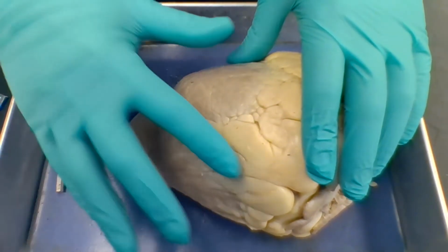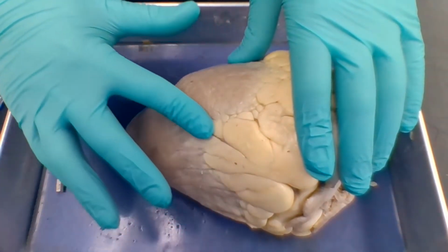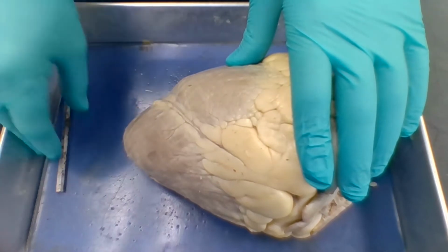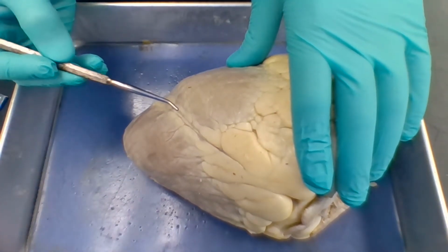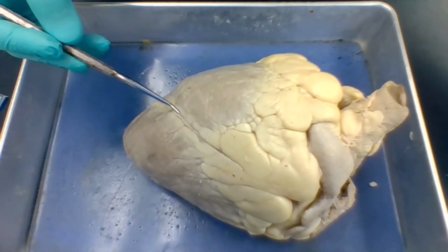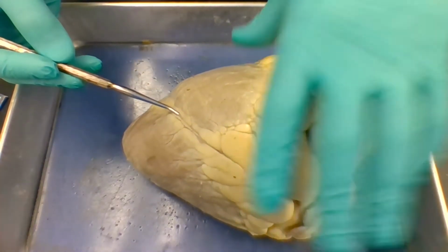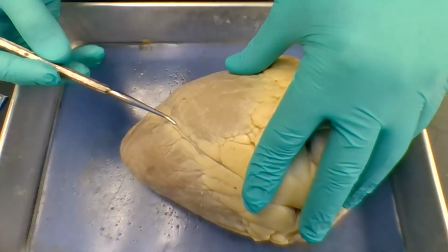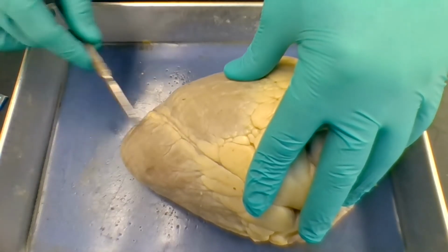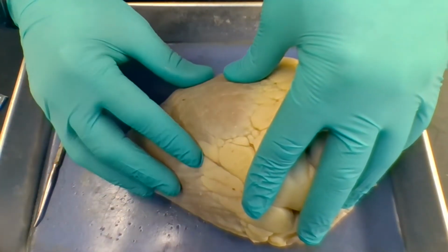This right here, you see that line? That is the interventricular groove, or interventricular sulcus, okay? Lying inside of that, right? So right here, there's an artery in there, okay? That's the left anterior descending artery, or the LAD, okay? This is also known as the anterior interventricular branch of the left coronary artery. So what can happen here is what is known as the Widowmaker Infarction. An infarction is a kind of a blockage, right? So this, as you can see, this supplies blood to the heart itself.